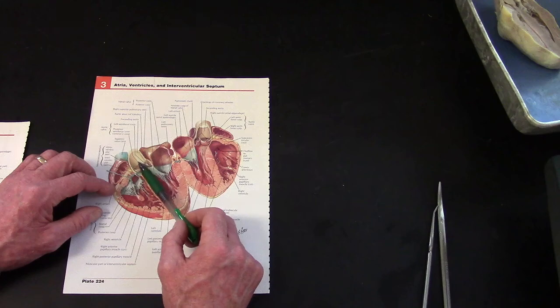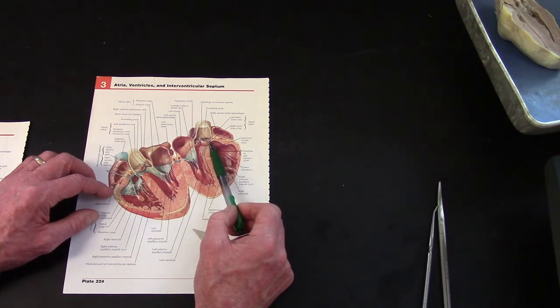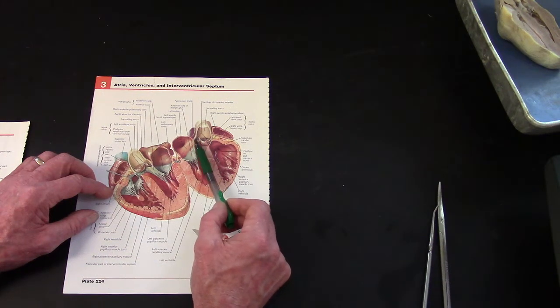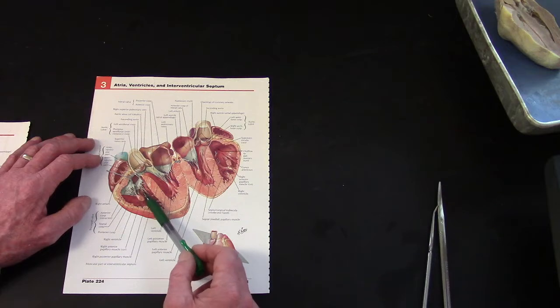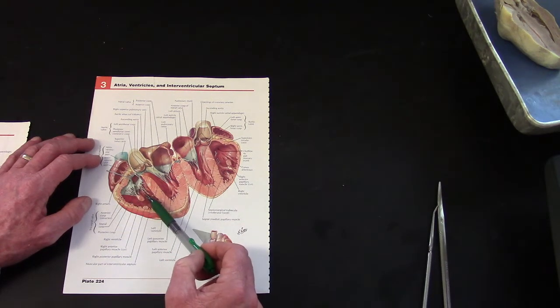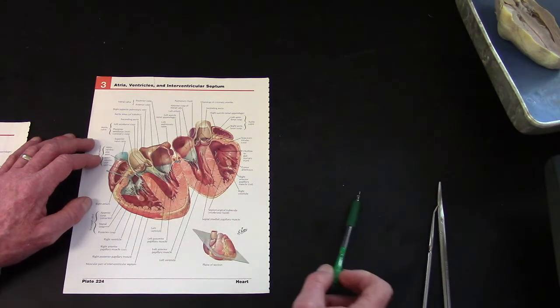The other side of the aorta is shown on this side, and if it shows up in the video, here again are flaps of the aortic semilunar valve, and directly behind the flaps there are the openings to the coronary arteries. That's interesting to find. Hopefully you can see that. The right side of the heart, here it would be the tricuspid valve, right ventricle, and the right atrium is not shown well.